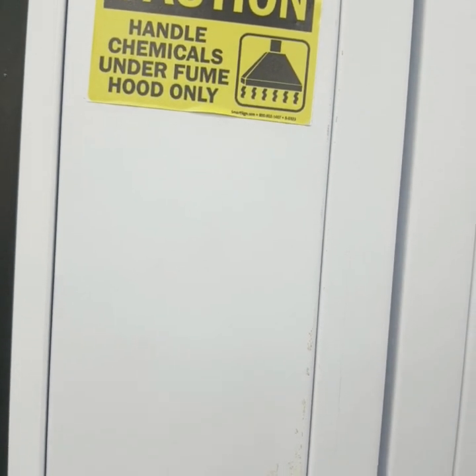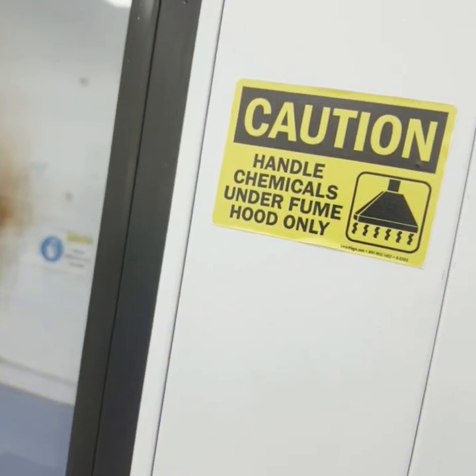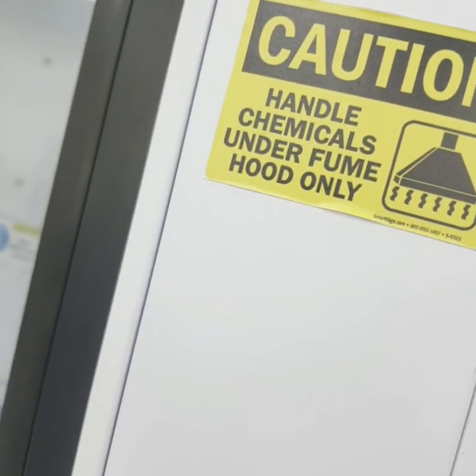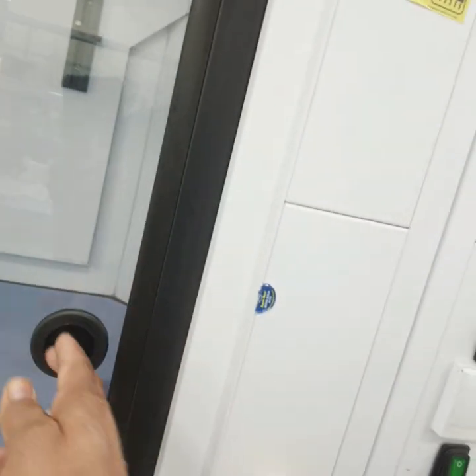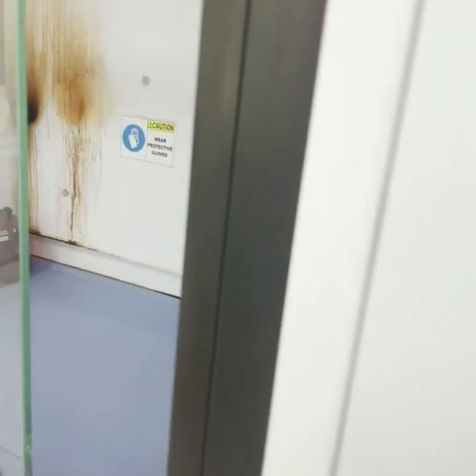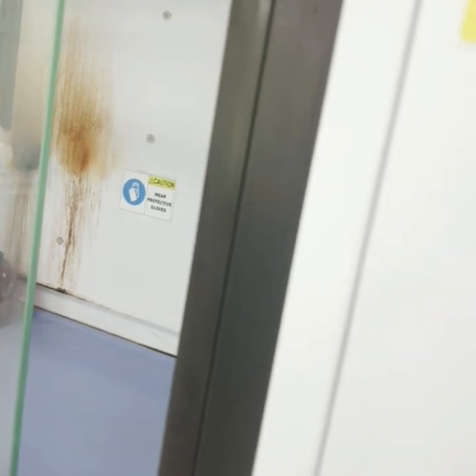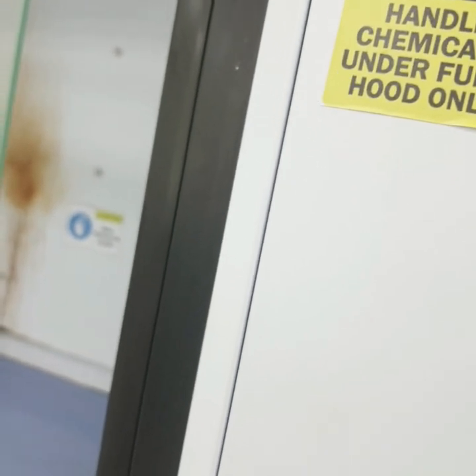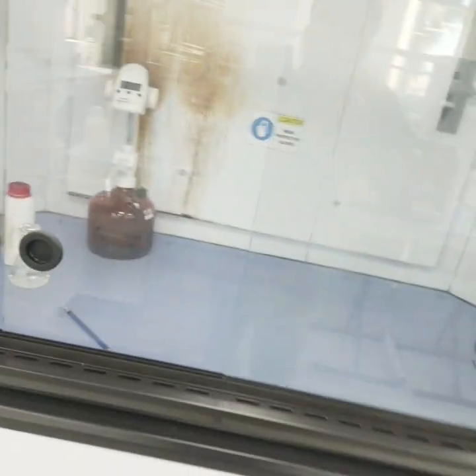The sash acts as a physical barrier in the event of an accident inside the fume hood. The operator should stand slightly away from the fume hood when facing it. Ensure the exhaust slot is clear, the sash height is around 18 inches, and there is minimum storage along the sides with a gap from the left or right extreme. Do not operate with the sash above the red maximum height arrow, and close the sash completely when not using the fume hood.